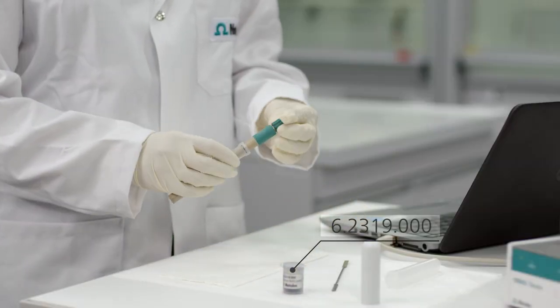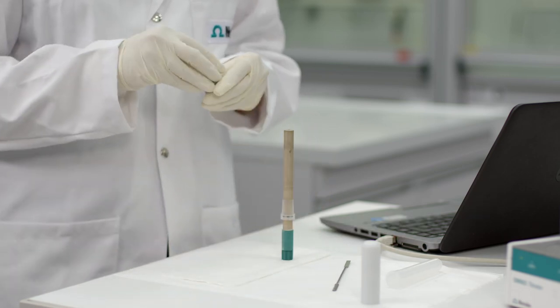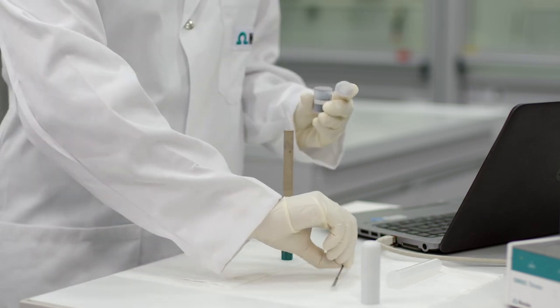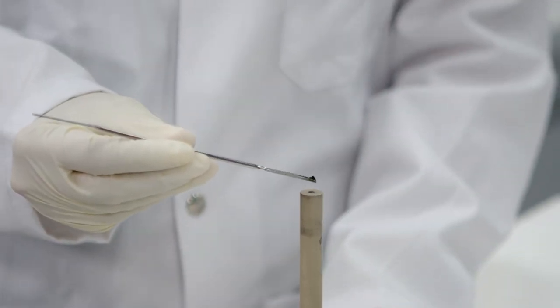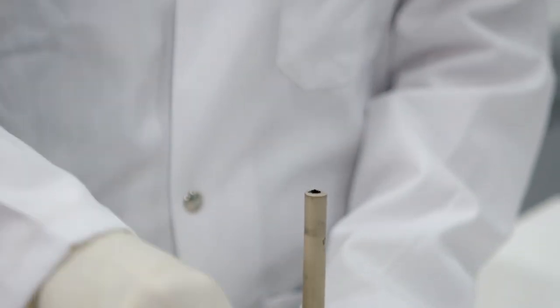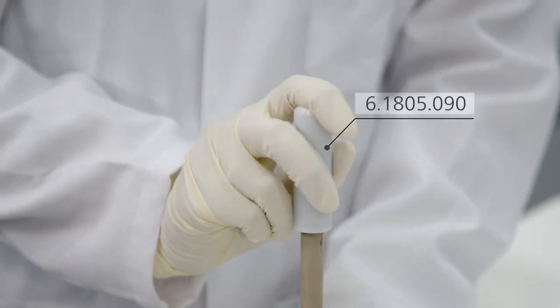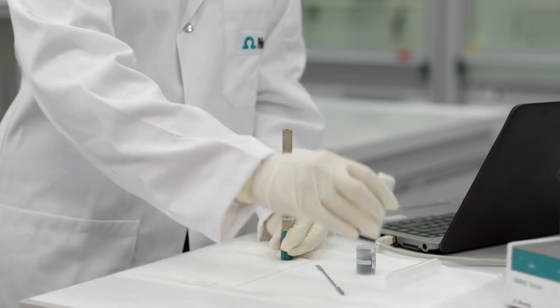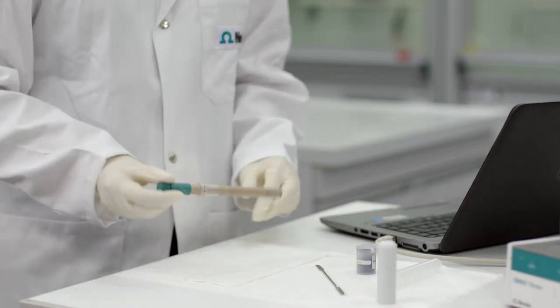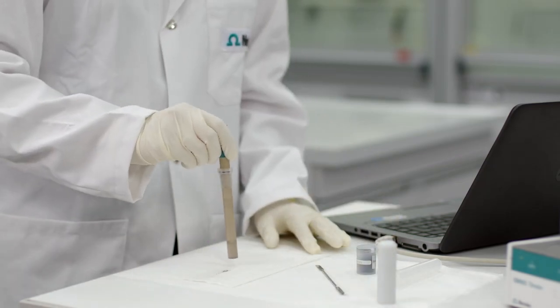Screw the cover onto the electrode head. Place a spatula tip of the refill paste on top of the electrode. Mount the filling tool and press three times to compact the refill paste. Afterwards, remove the excess paste with a soft paper towel. Repeat this process if necessary.